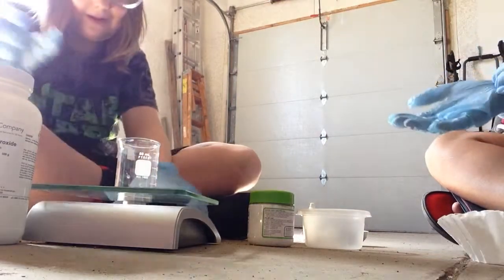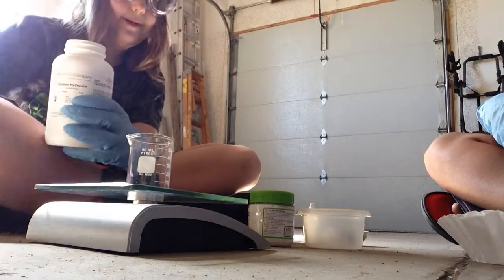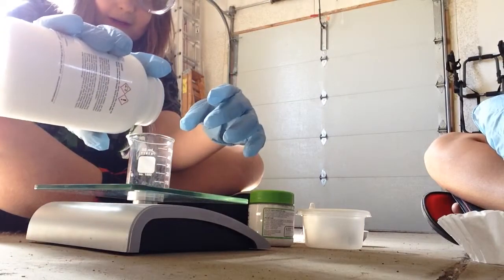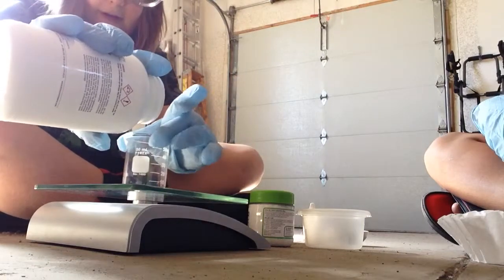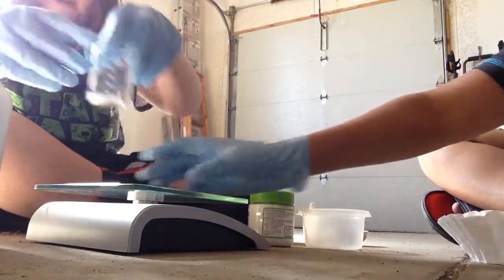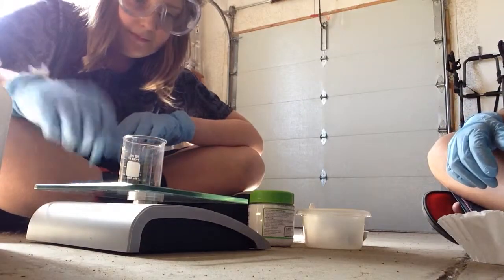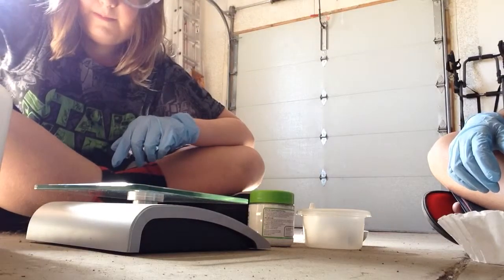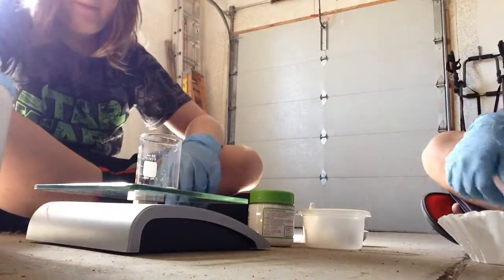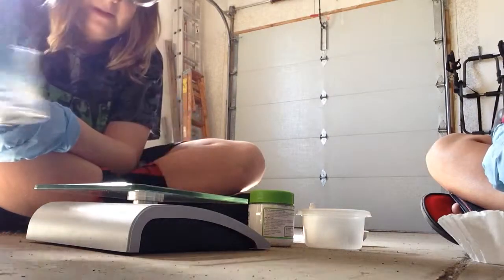So now that it's zeroed out, let's measure — how many grams are we gonna measure? Four grams. I said six. Six grams of calcium chloride. Sodium hydroxide. Let's see — that's about here. Gotta pour a little back in because I had five grams. I still have five grams. Now I've got four. So, oh wait, we're also gonna need water, but we can get that in a second. Here's our sodium hydroxide.